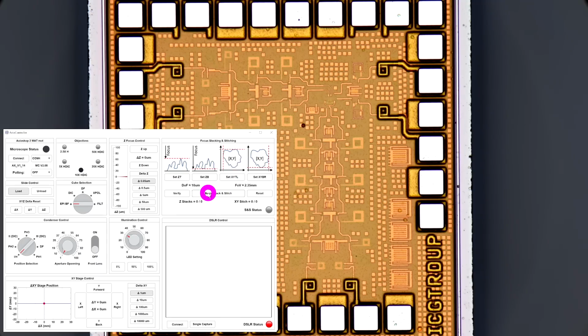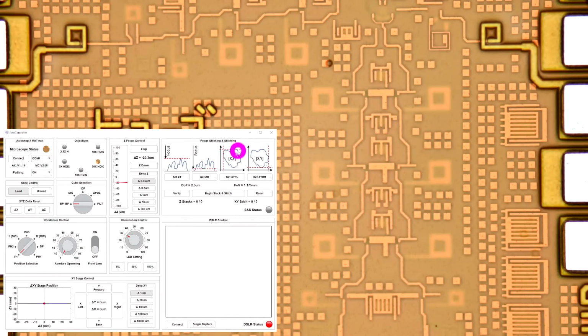This is very similar, by the way, to any camera that you would use. It's also a function of the aperture ring, which is now almost open, so it's not in the equation in this case. If I change the lens to a new lens, I'm going to put this on polling, so it's constantly sampling what's happening. If I turn it into a 20x lens, of course, the image is going to be more zoomed in, and you can see now the depth of field is only 2.5 micron.